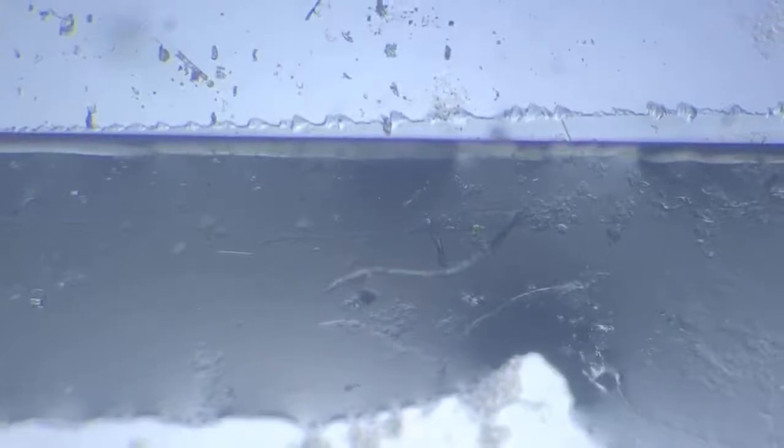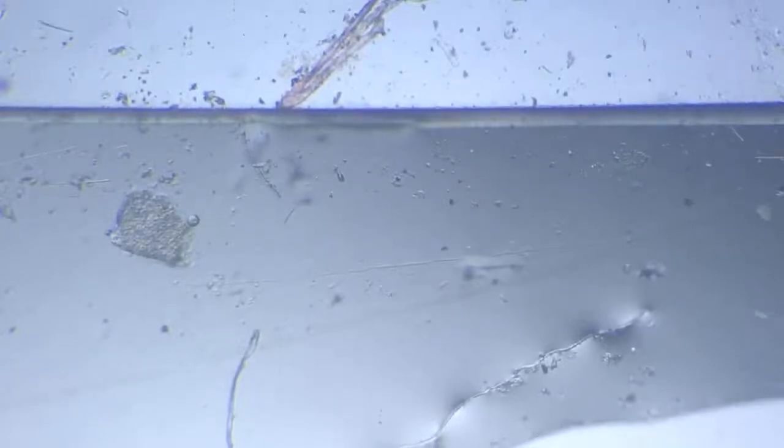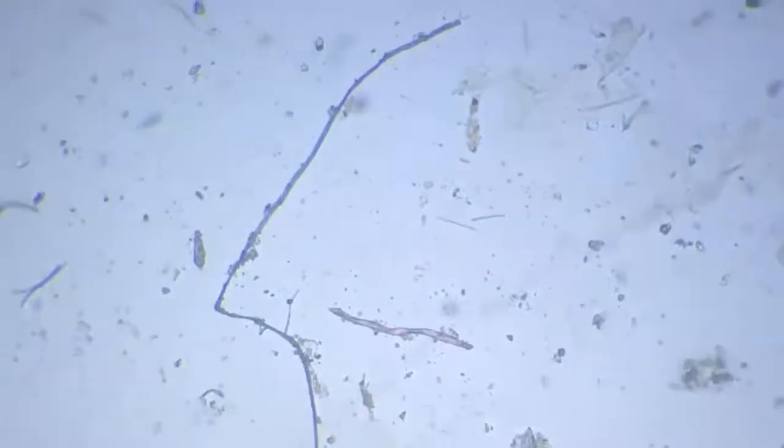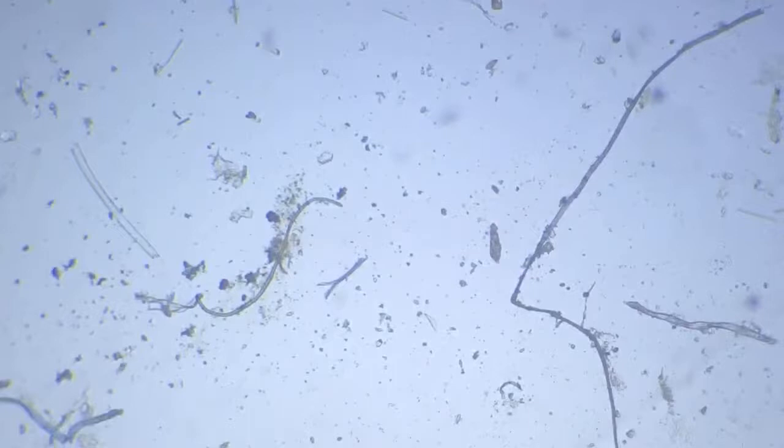Well, let me admit, in my enthusiasm of zooming further, I happened to crush the objective lens upon the cover glass and got it pressed against the slide, which has caused a lot of trouble in this area. The organisms might have been crushed and many must have died.